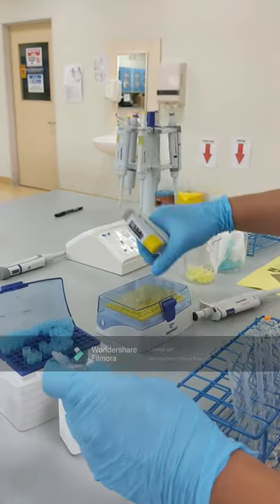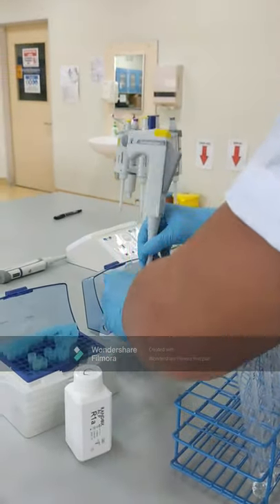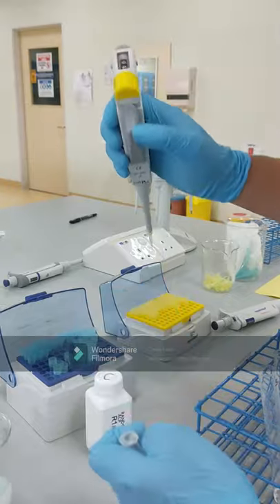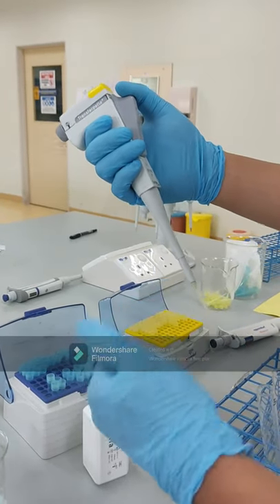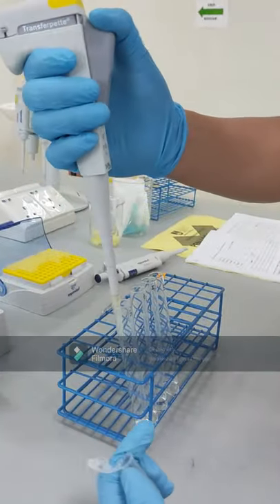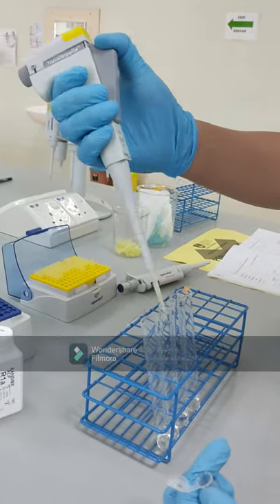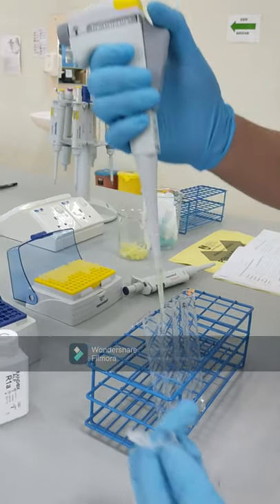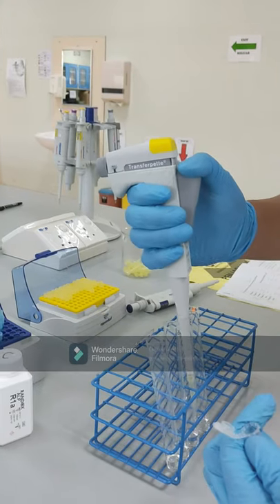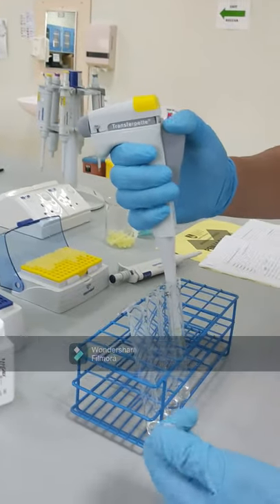Make sure you set the pipette volume correctly and then put the tip. When taking the liquid, remember from the previous video how to use the pipette — you have the second stop and first stop. When you release, remember how to remove the tip. Because you are using the same tip, make sure you don't touch the tip at the wall or into the liquid. If it already touched, then you need to change your tip.